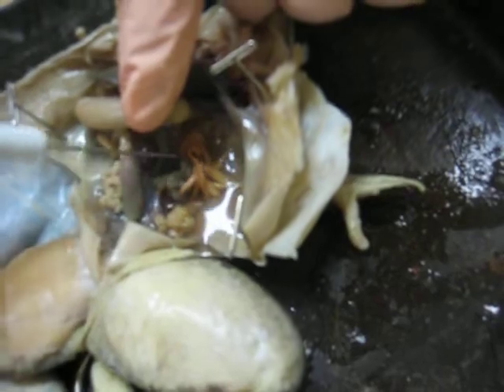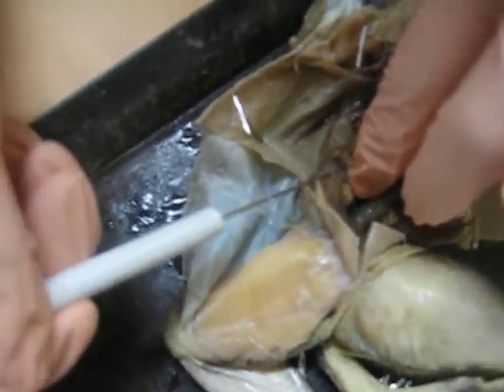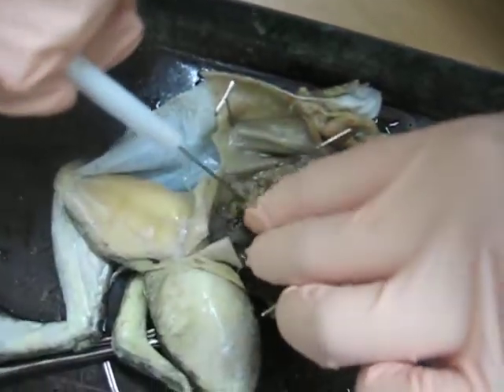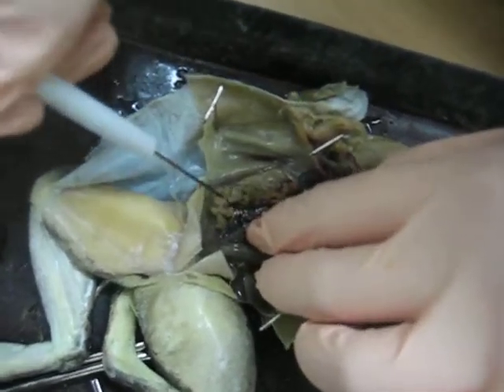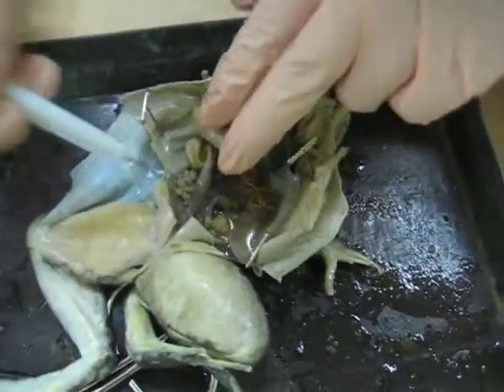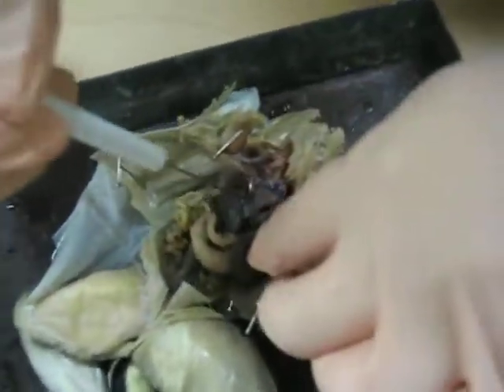The vestibule oviducts — I believe those are these right here. Those little spaghetti things? Then what are these right here? Those are the oviducts. Vestibule oviducts, and these are your oviducts. What are ovaries? Your ovaries are this one and this one. And then your heart, right there.